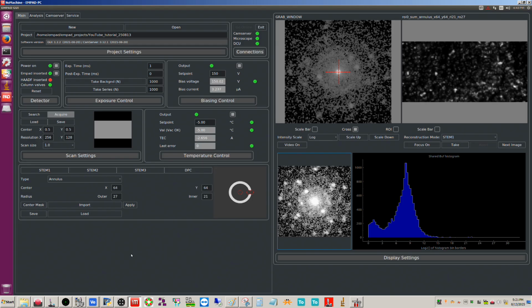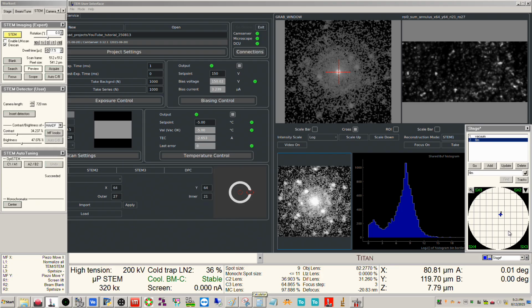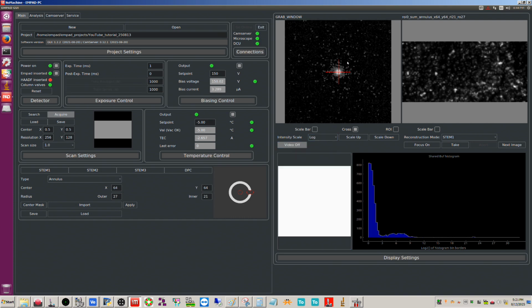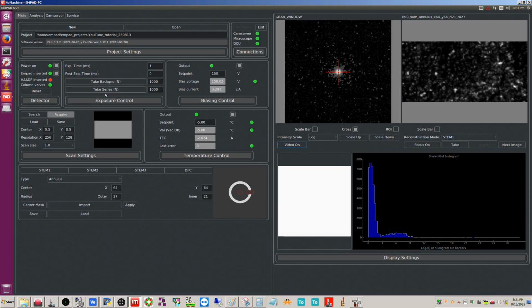Okay, so with the take series, I mentioned I did this with the parallel beam diffraction patterns. The other thing you can do with this, which is very useful, let me go back to, so I stored a stage position that is just vacuum. So I'm going to go to that and do video on. Okay, so you can see this is just vacuum now. This is now the probe in vacuum. So if you do a take series of 1,000, I'm going to go ahead and do this.